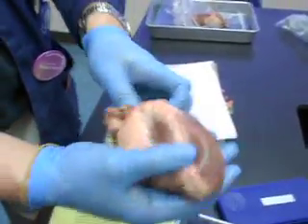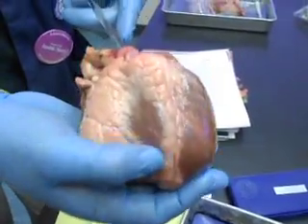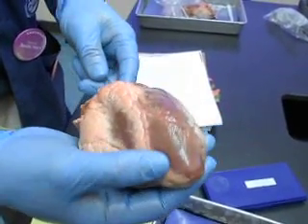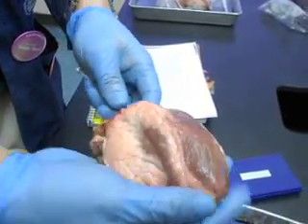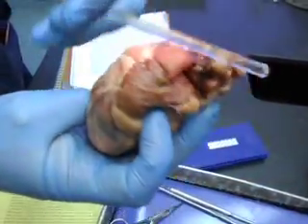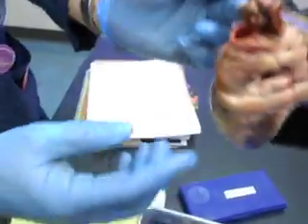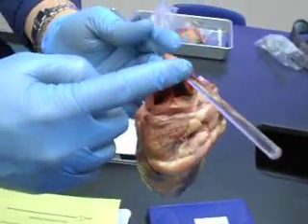The pulmonary veins are gone? Yes, they're cut off. From the left atrium, through the bicuspid valve, through the left ventricle, out the left ventricle through the aortic semilunar valve, through the aorta, and the brachiocephalic and the subclavian.